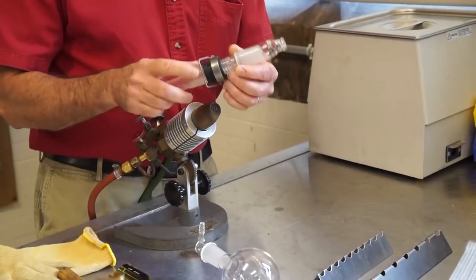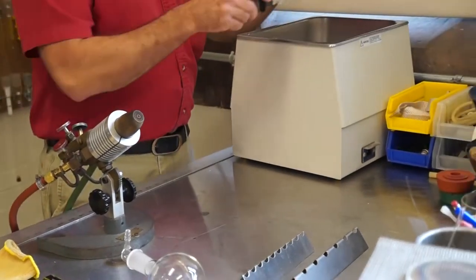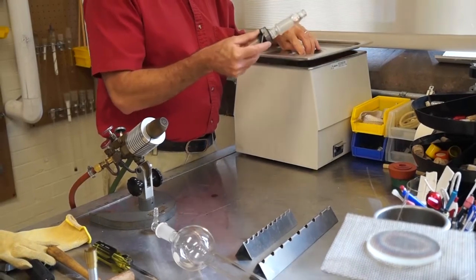If that doesn't work, if you have an ultrasonic cleaner, you can just take this and simply soak it in your ultrasonic cleaner for as long as necessary and sometimes that works.